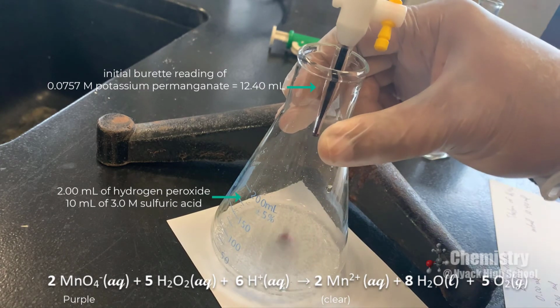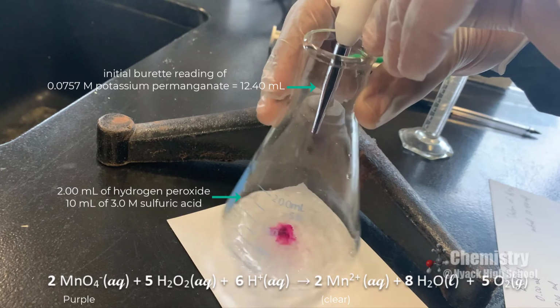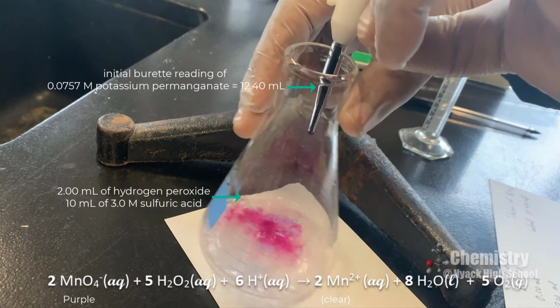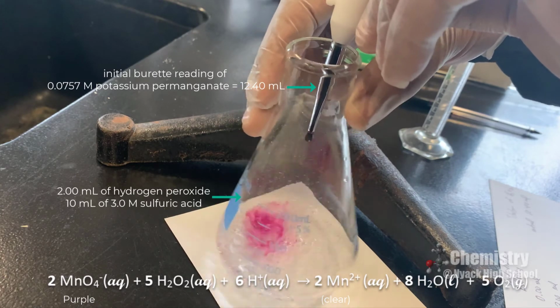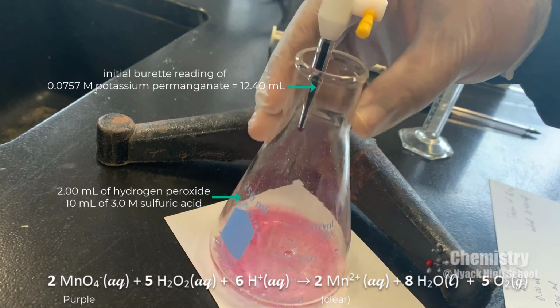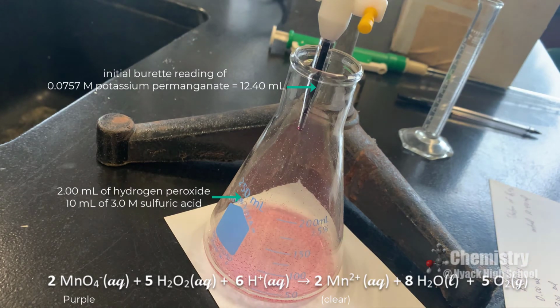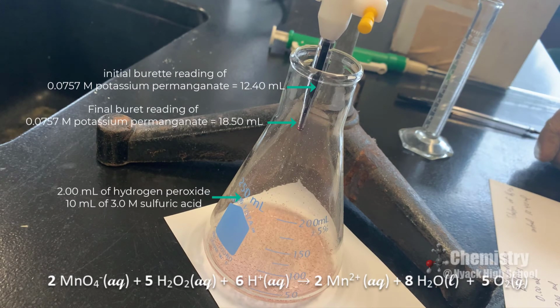Going slow pretty much anyway. Let me speed it up a little bit maybe. Okay, I'm starting to get close. Okay, I think I'm there. So I'm going to read the burette again, and it looks to be about, let me read that again, 18.50.